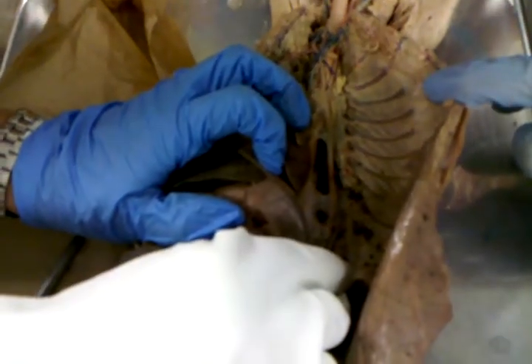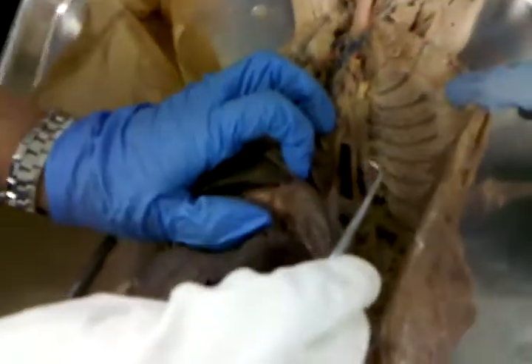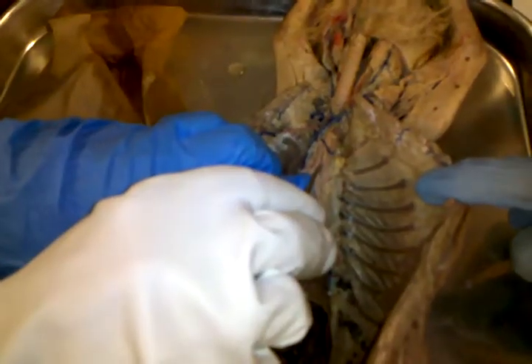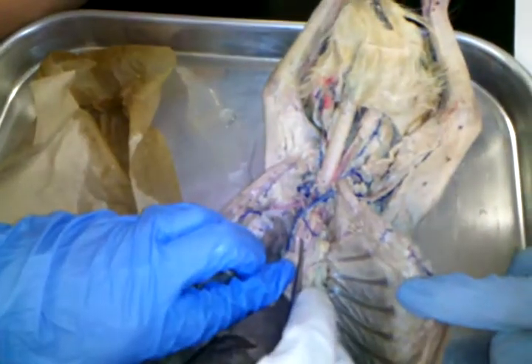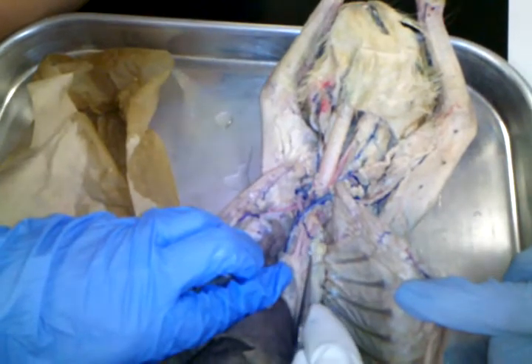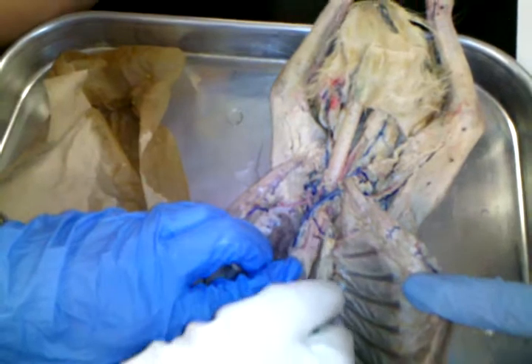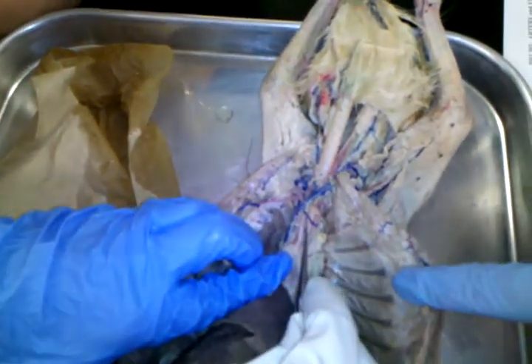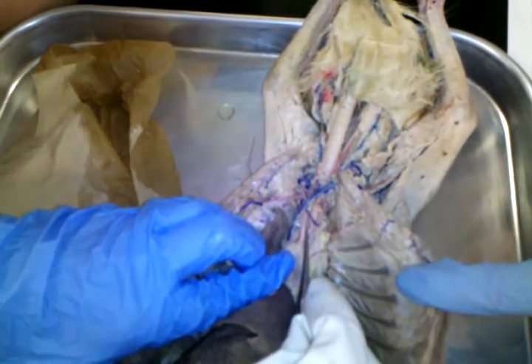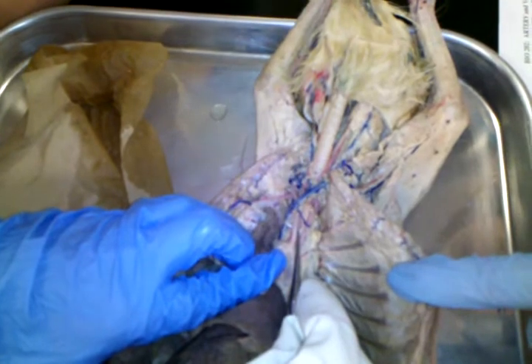Those are intercostal arteries. Now, if you'll pull out your diagram, Tim, you might want to pause it. All right, the left common carotid. Well, in cats, there's a brachiocephalic that comes off, and then there's the left subclavian, okay? Now, the one called the brachiocephalic then branches. Brachio means arm, cephalo means head. So this is going to branch off and take things to the head and arm.